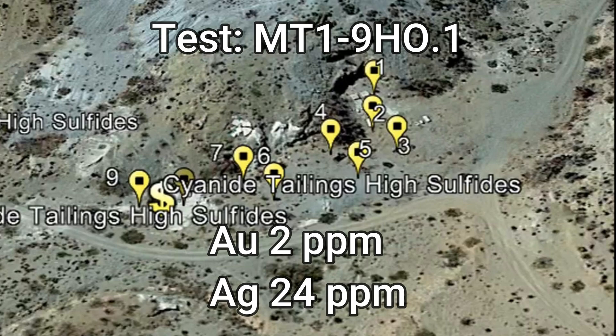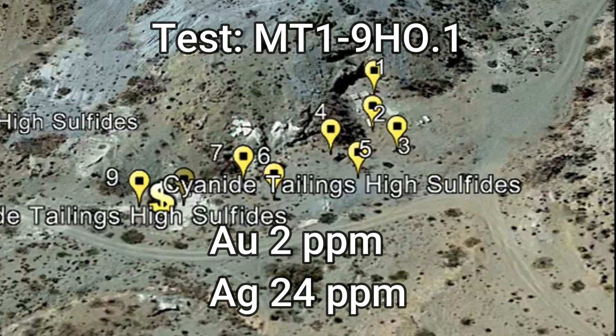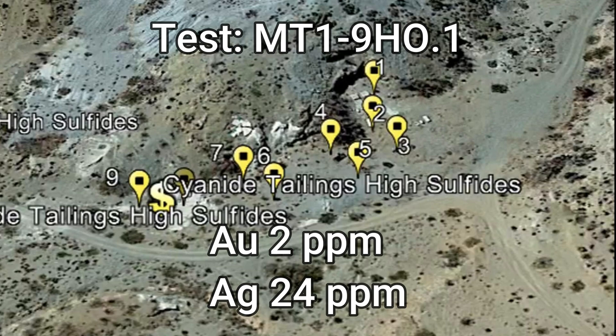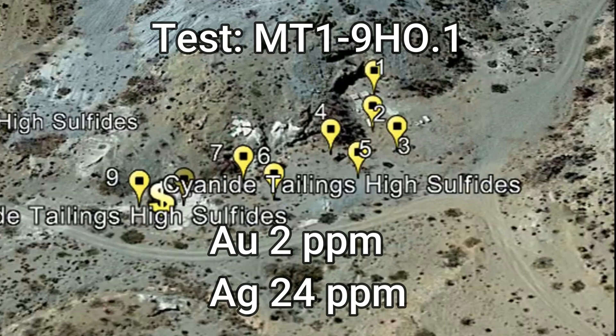Not exciting numbers, but there's some opportunity here. When we took our samples, holes one through five were really boring looking — not mineralized at all — but samples six through nine looked great. They were primarily the tailings, had sulfides in them, and we believe we completely diluted the sample with low-grade material. We need to go back and assay only the cyanide tailings separately to get a representative sample.